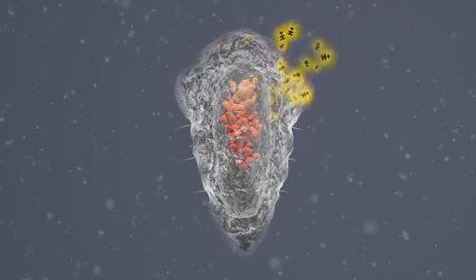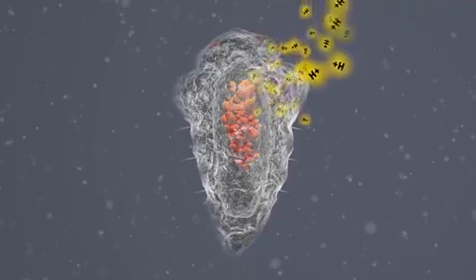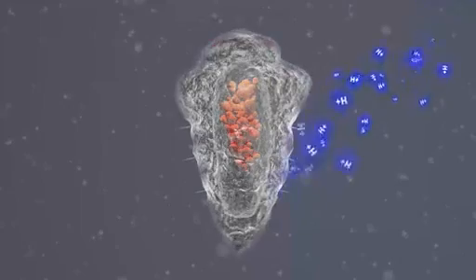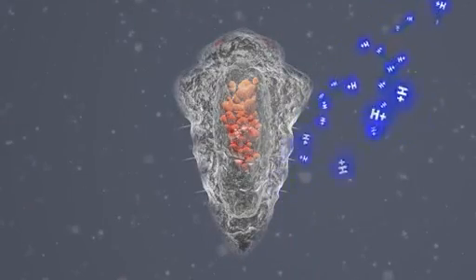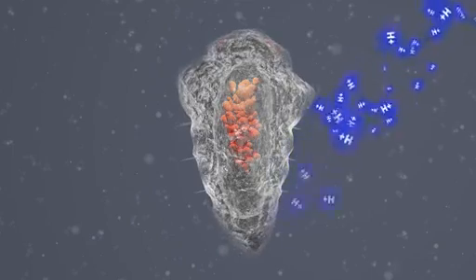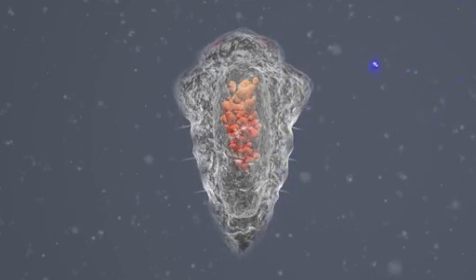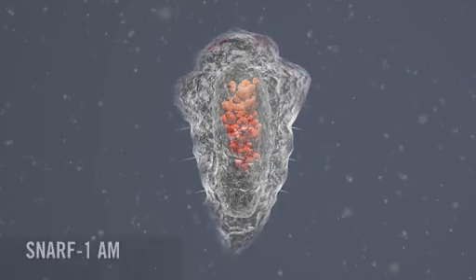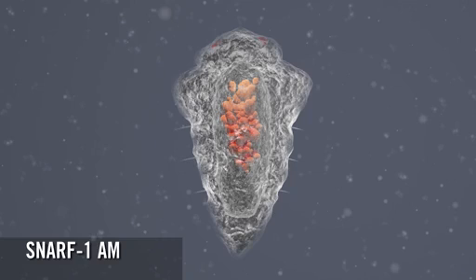Intracellular pH imaging allows us to study the concentration of proton into and out of the cytoplasm in the process of calcification. To begin intracellular pH imaging in the marine tubeworm larvae, the competent swimming larvae are stained with the intracellular pH indicator dye SNARF1-AM.